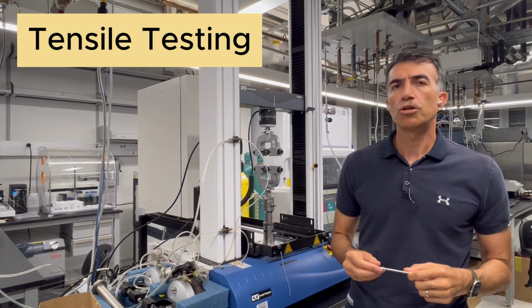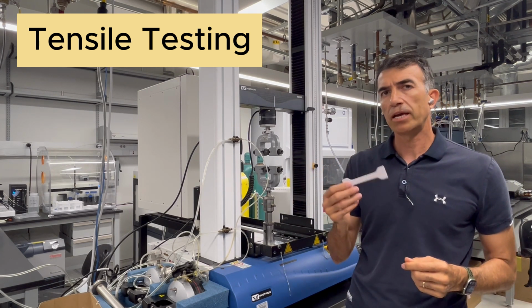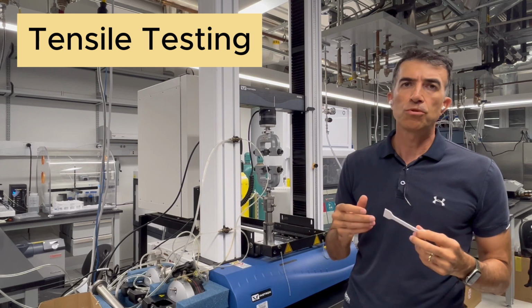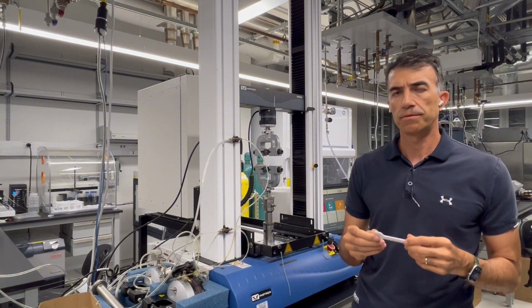Another machine that we're going to use for this root cause analysis is the tensile testing machine. We're going to make dog bone samples and stretch them under controlled conditions to see the response of the material to mechanical loading.